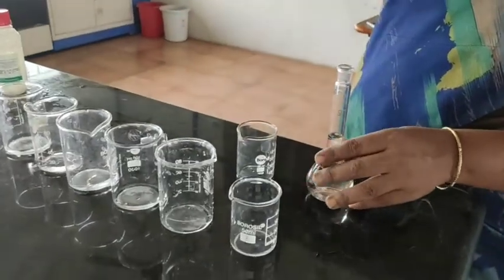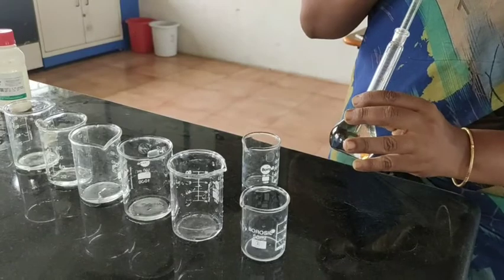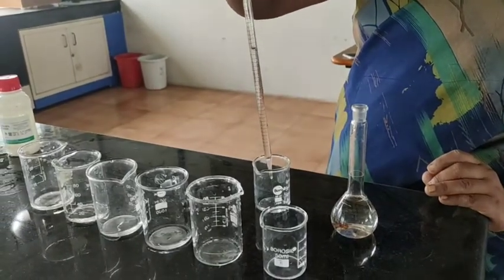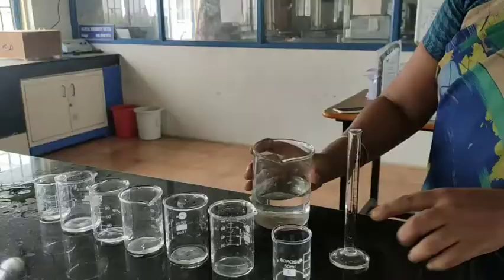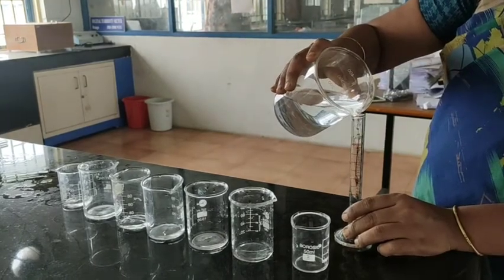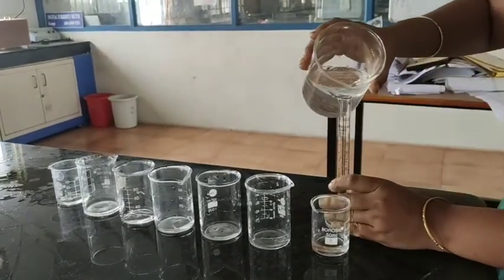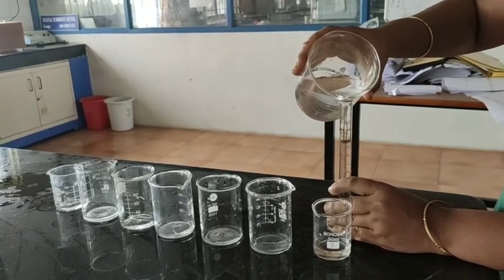The stock solution portions are taken into volumetric flasks or beakers. For the sample, we are taking 2 ml. The blank is plain water. We have to make up all flasks — both stock standards and sample — to 25 ml.